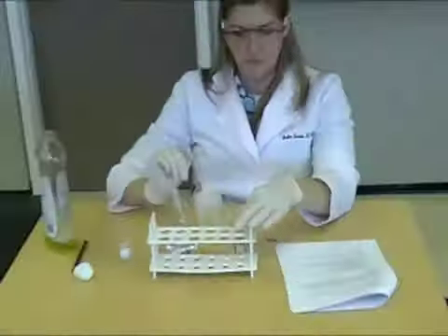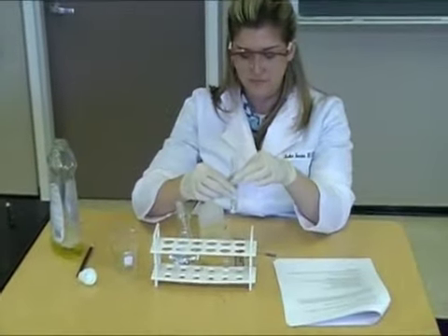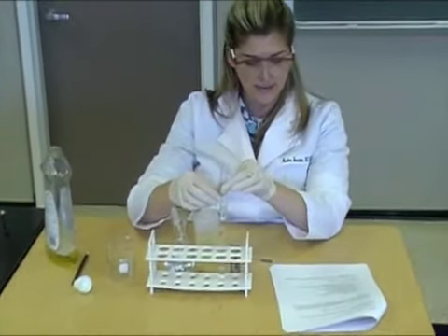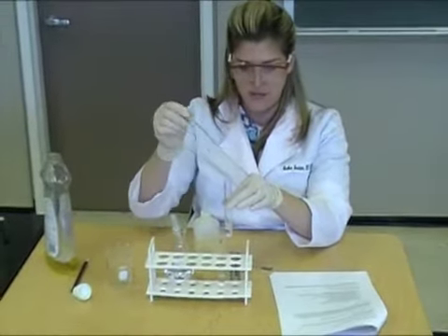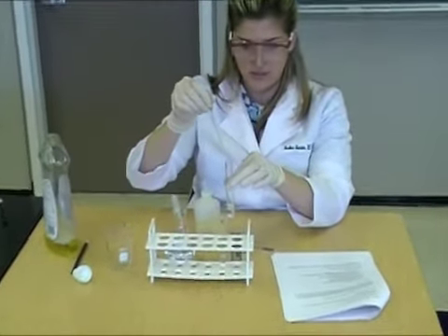Go back to test tube 1 and add a few drops of your diluted soap solution. Then tap and observe your results.